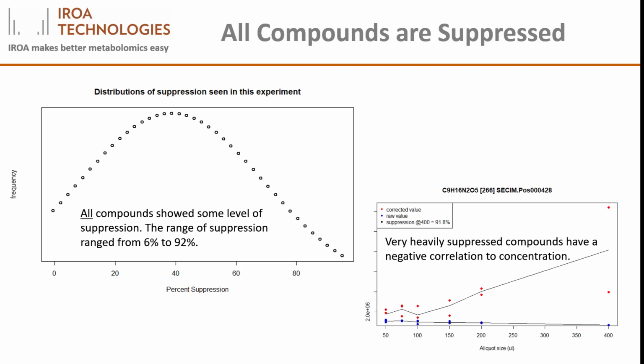Those compounds that were suppressed between 60 and 80% were simply not correlated. Injecting more compound did not result in a larger peak. And those compounds suppressed more than 80% showed a negative correlation, as shown here. The more compound injected, the lower the signal seen.